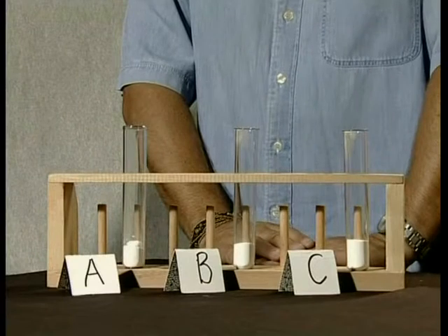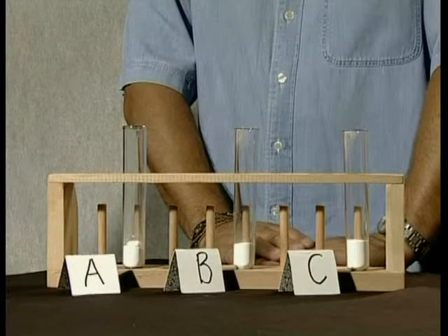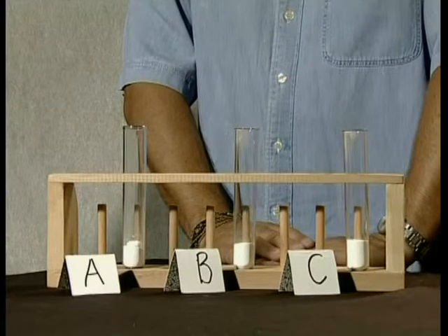Hello there everybody, my name is Bruce and welcome to the last in our series of lessons on chemical solutions. Today we will consolidate everything we have learned so far and use our skills to identify three unknown salts. We have placed them in three test tubes labelled A, B and C respectively.